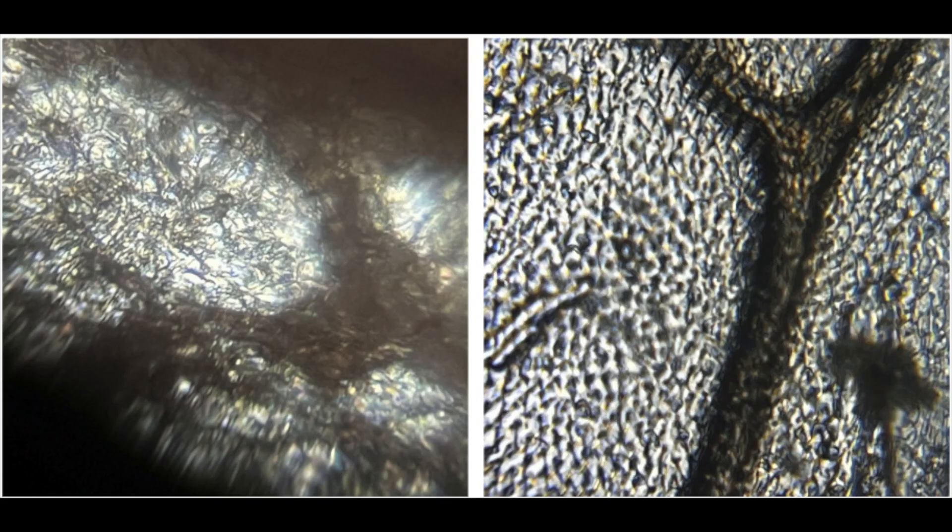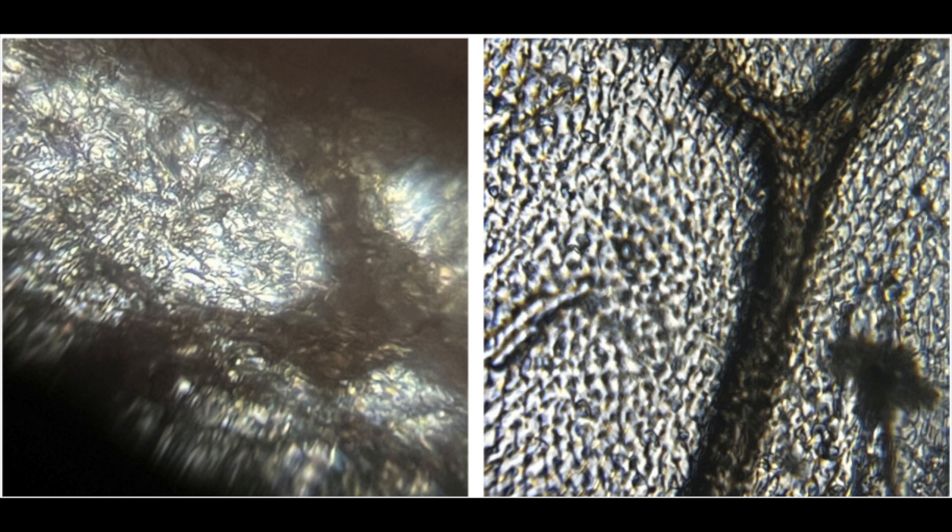The space in between the veins on the leaf looks almost cloudy and hard to see through. There is some indication of cell walls, but it is challenging to clearly define them. The insect wing membrane is transparent and has places on it with tiny hairs.